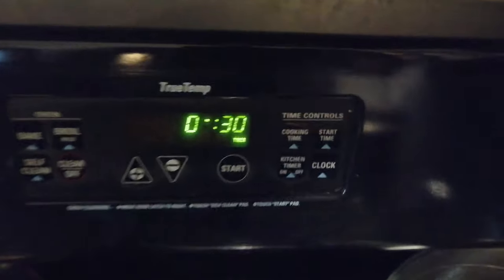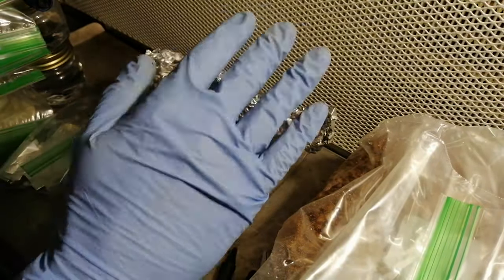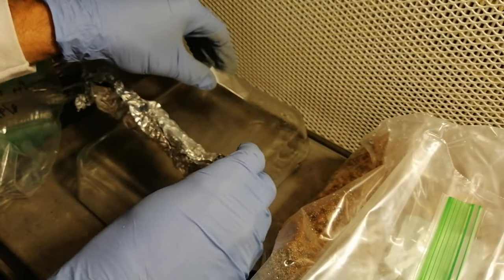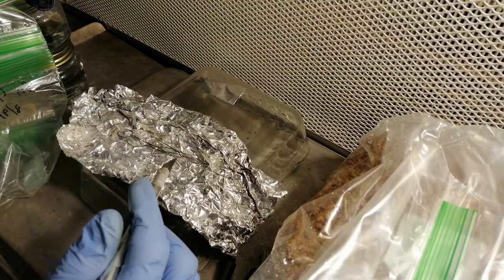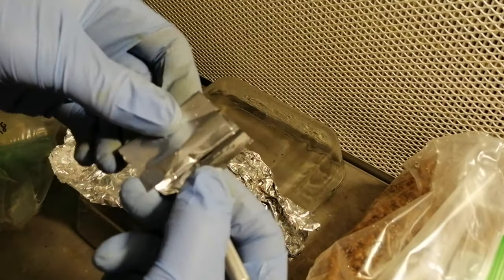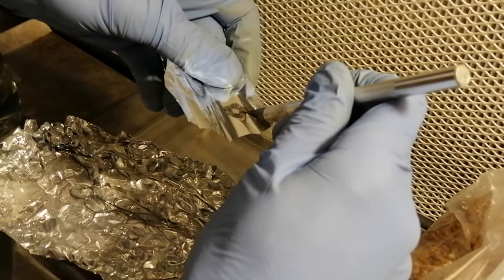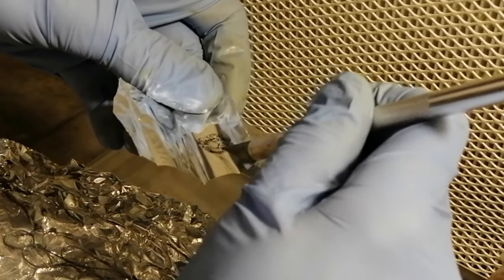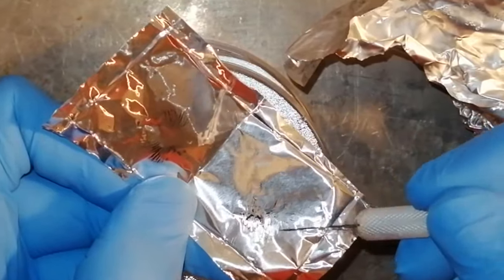After the pressure builds up, set a timer for 30 minutes. Now back in front of the flow hood, it's time to transfer some spores to the agar dishes. You will need a sterile knife and an inoculating loop. Wear nitrile gloves and spray them down with 70% isopropyl alcohol. Sanitize your working surface and take out your tools: an exacto knife, a spore print, and your inoculating loop. Only open up your spore print in front of a flow hood or in a still air box. The spores will be stuck to whatever surface they came on, so the first thing you should do is scrape them with your sterile knife to loosen them up — do this carefully and try to make a neat pile of spores. Even a very light print can contain hundreds of thousands of spores and you should be able to create a visible pile of loosened spores from it.